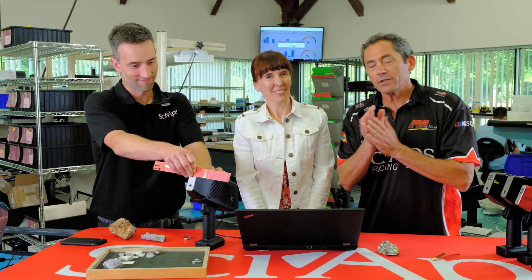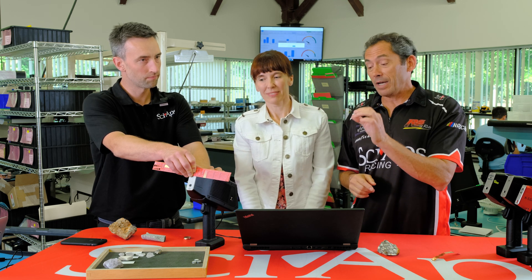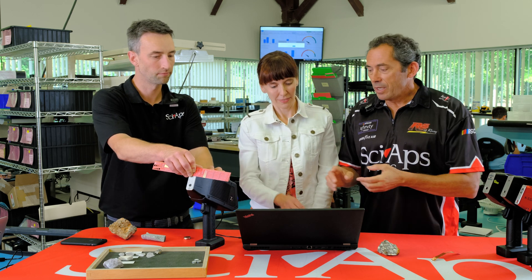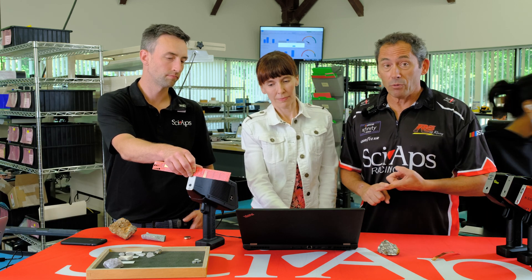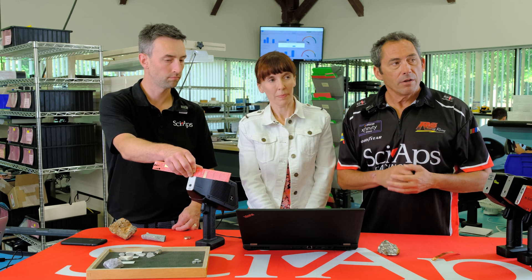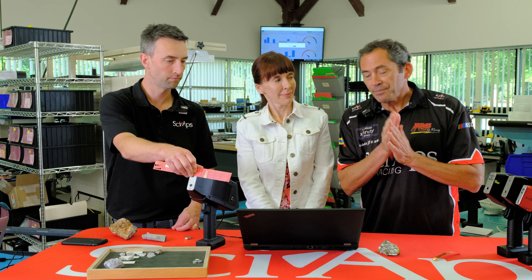We'll show Geochem Pro, which uses our LIBS device and does elemental mapping of a rock or material, so you can look in hundred or so micron spots to get elemental data across the surface and map it. A really popular application right now is in-field measurements of lithium, especially. Lithium is a really high demand element because of the EV market. We've got our handheld LIBS which does the full range of elements including lithium, and we also have a smaller handheld set up just to do lithium and a few related elements in rocks, and in the future, brines.